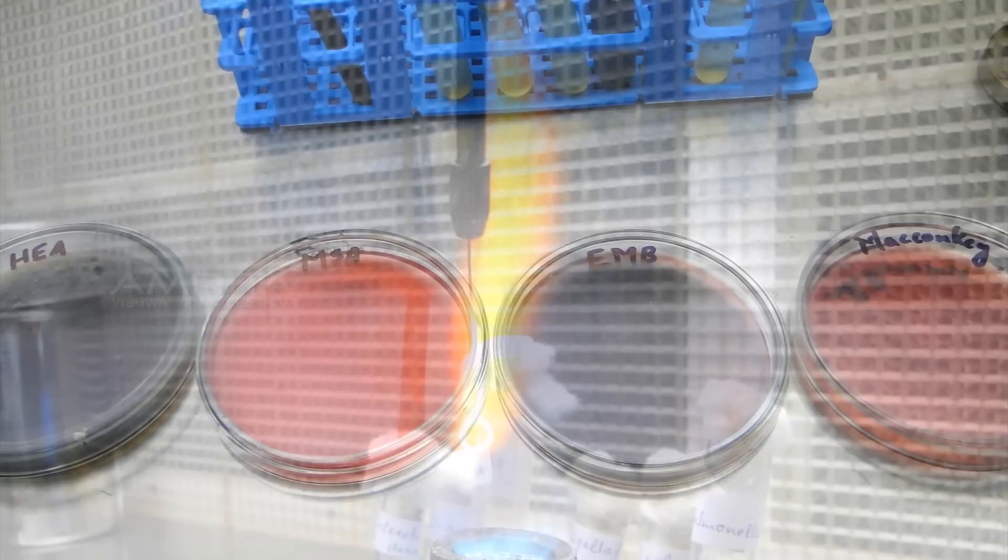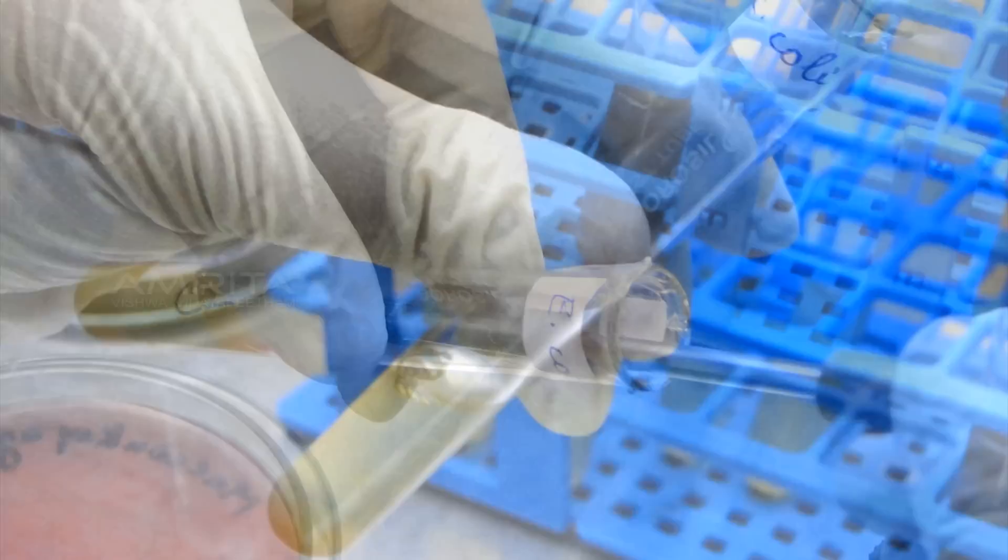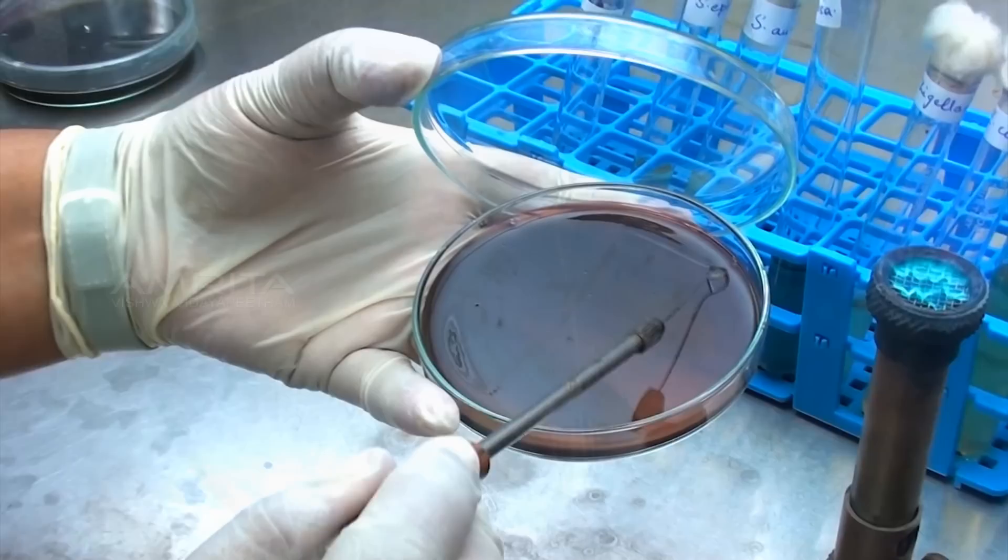Procedure: Arrange all the cultures and media in the laminar air flow. Flame the inoculating loop and transfer a loopful of culture from the tube labelled Escherichia coli onto an EMB plate and perform a continuous streak.